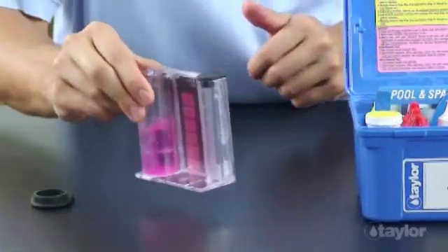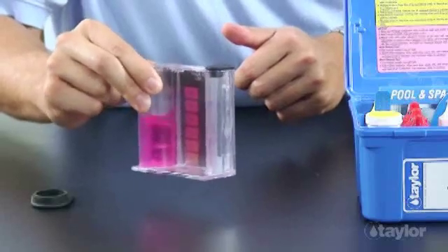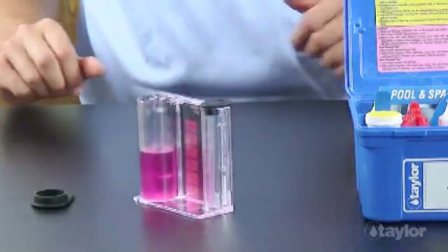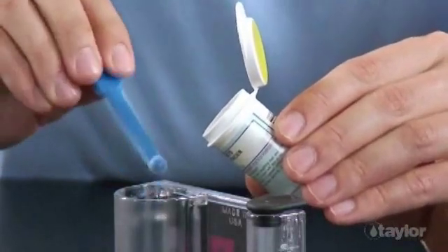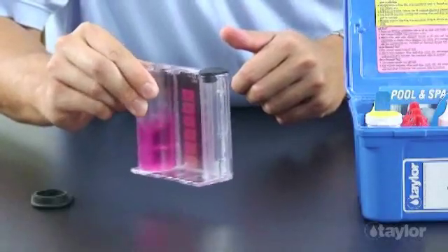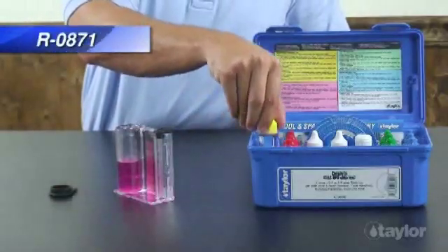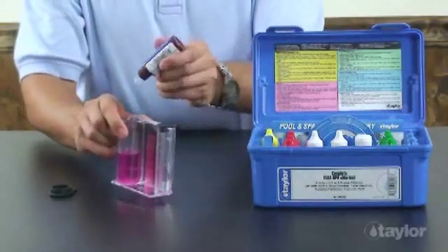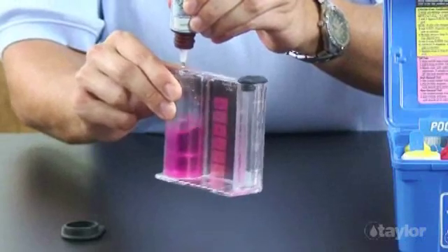Swirl until all the powder dissolves. If free chlorine is present, the sample will turn pink. If the pink color disappears, continue adding the DPD powder a dipper at a time, mixing between additions, until the sample turns pink again. Add reagent 871 for chlorine drop-wise, swirling and counting after each drop until the sample goes from pink to colorless.